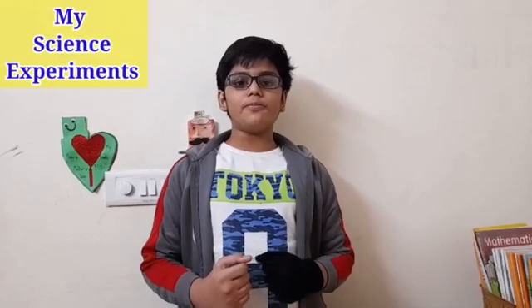Hello everyone, my name is Madhav Dusan and today I am going to perform a science activity in which I will produce hydrogen gas. So how will I do it?